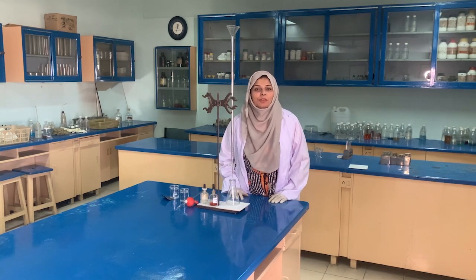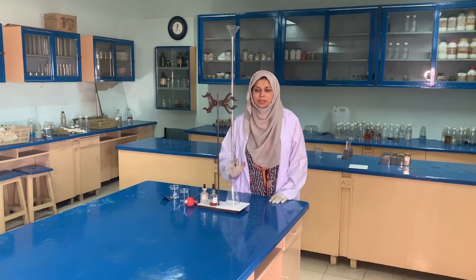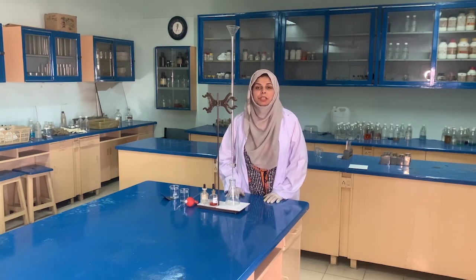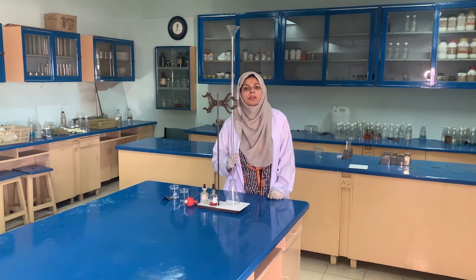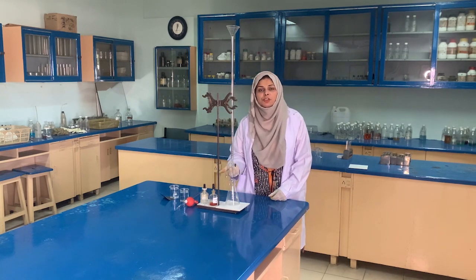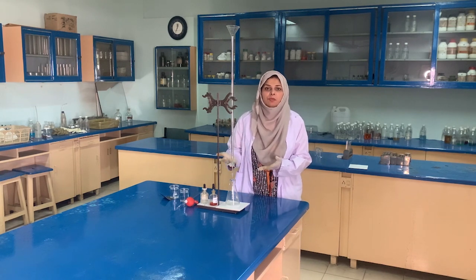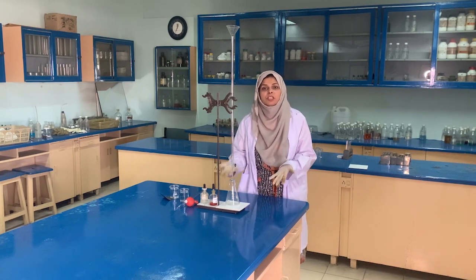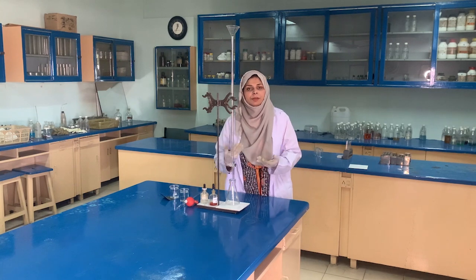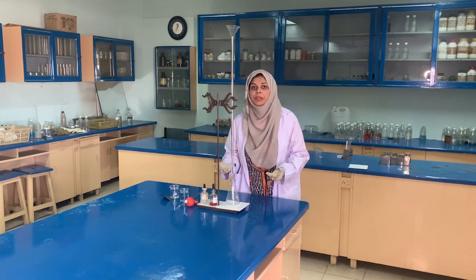Hello guys, Assalamu alaikum to all of you. Today we are going to start a lecture on titration. This is the acid-base titration through which we can identify the percentage composition of a substance, and we can get the Mr, Ar, number of moles, or mass of specific substances. It depends upon the experiment what we are going to find out.